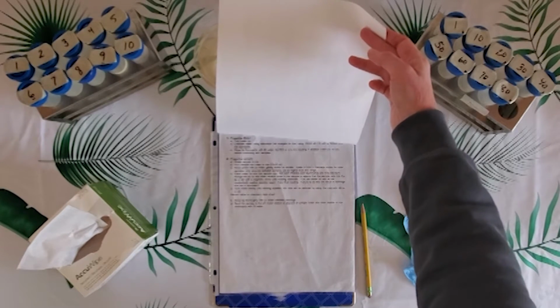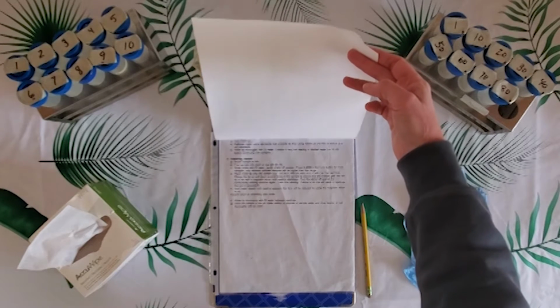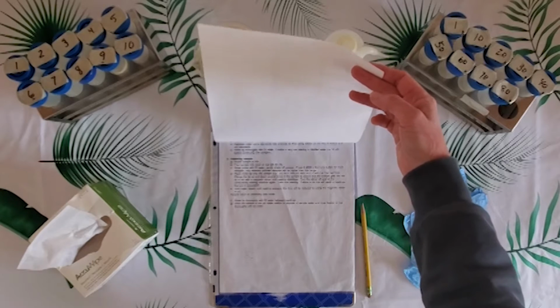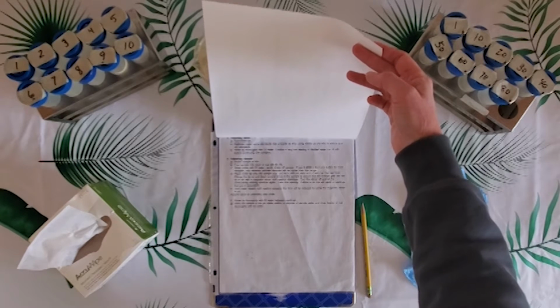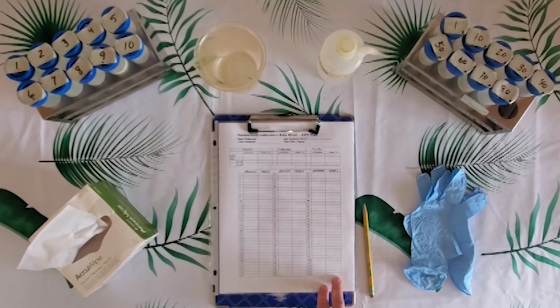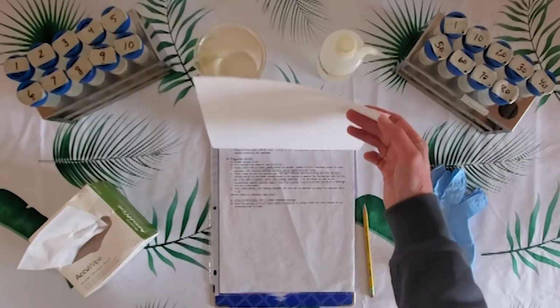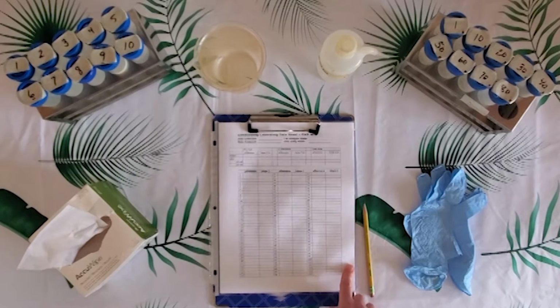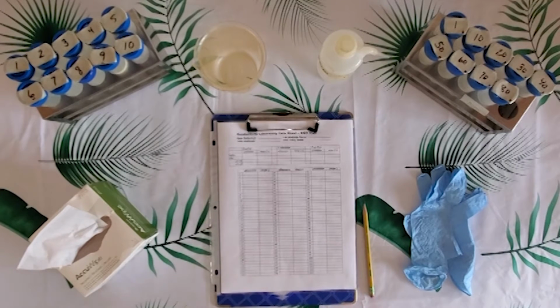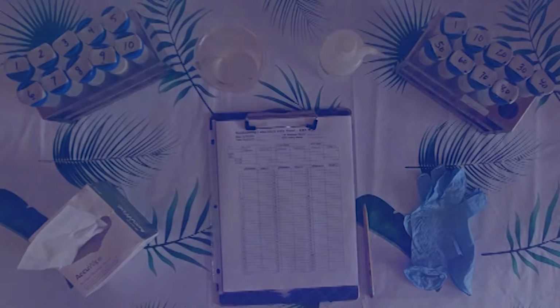Underneath this form are the instructions for this particular test. So these are the directions for the conductivity method, and each one of our stations will have a similar data entry form and will also contain the instructions for that method. We will continue on and discuss each one of those particular tests in detail coming up.